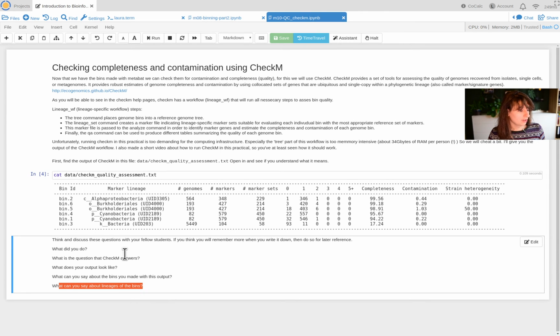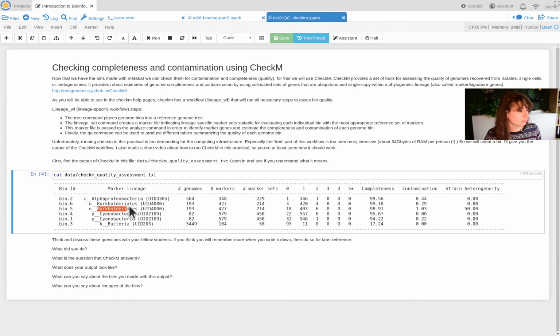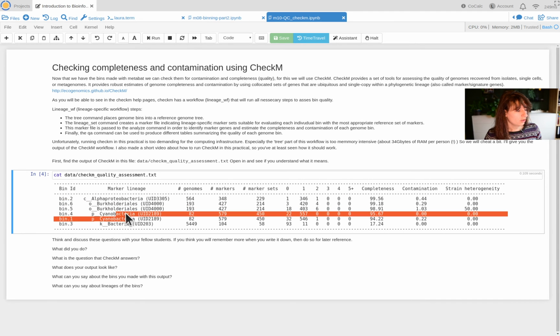What can you say about the lineages of these bins? So Burkholderiales are, I think, beta proteobacteria. So we have a bunch of proteobacteria and two cyanobacteria. That's also quite specific. So what's the fun thing to do now? This table is definitely something that you will put into your report for your master research project.